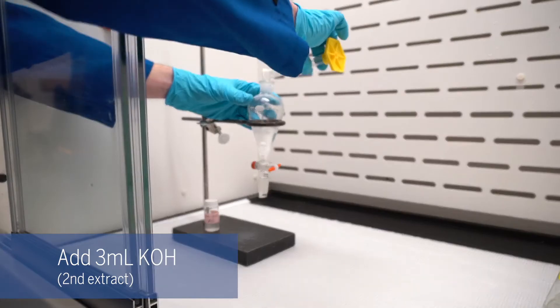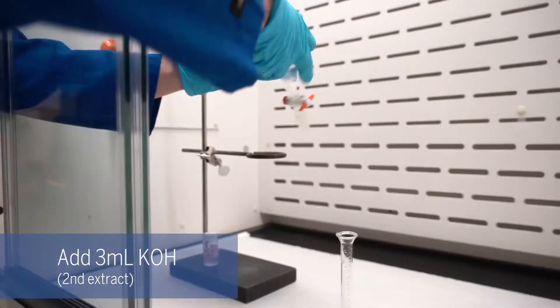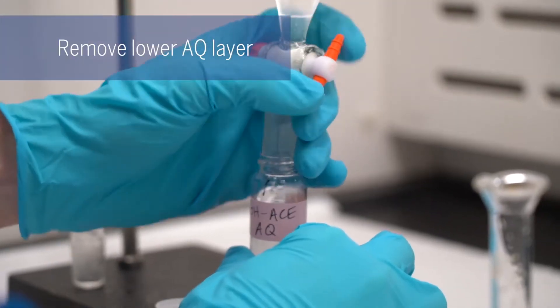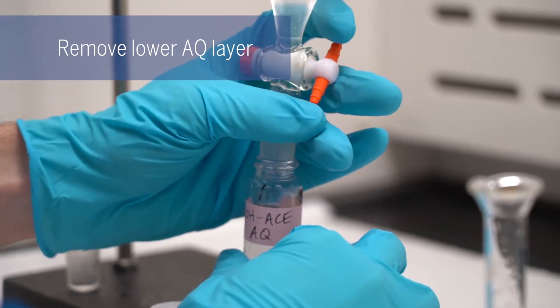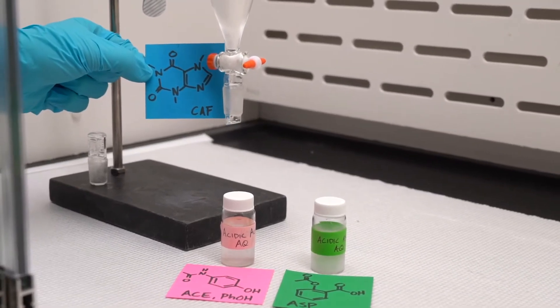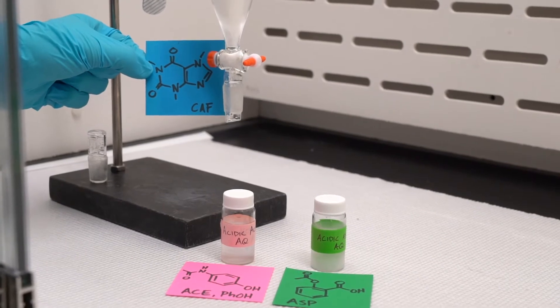Now I'm going to add a second smaller portion of potassium hydroxide. This time we're going to carefully try to get every last drop. At this stage we've successfully separated the three components of Excedrin.